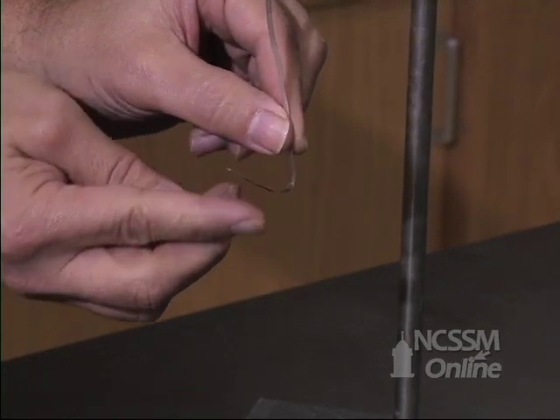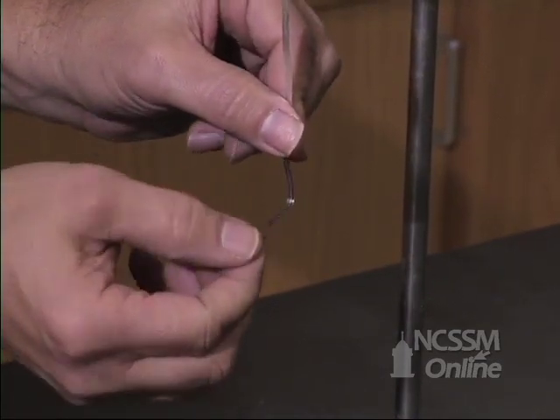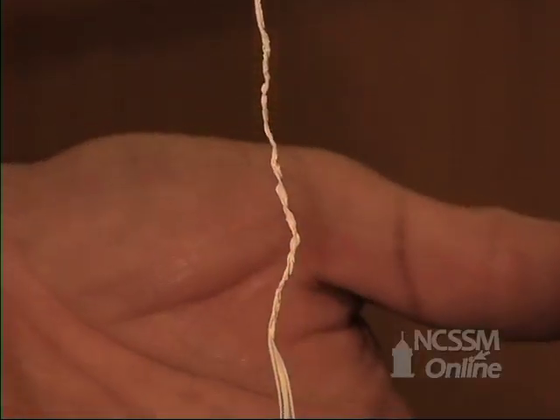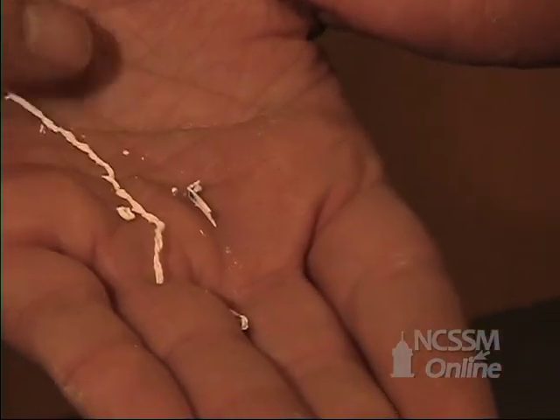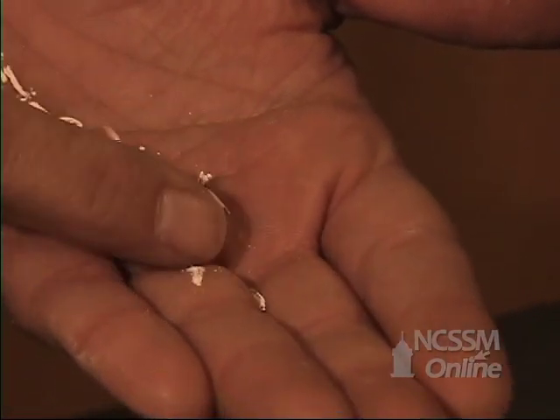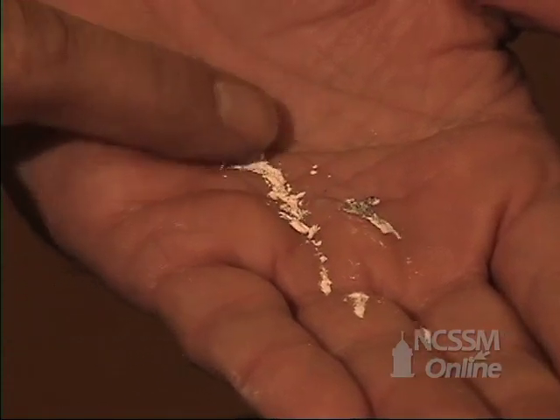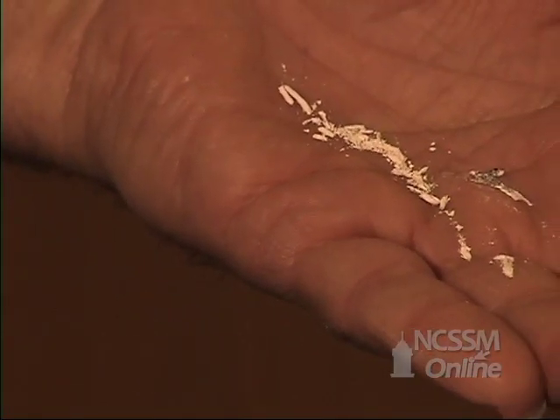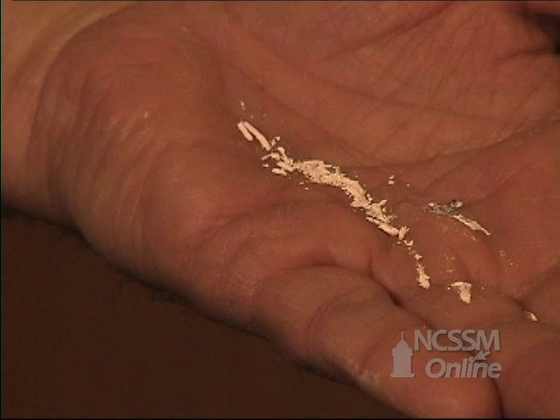Unlike the flexible metal, the ionic compound is a very brittle white solid. We have lost the properties of the original metal and we have created new properties for the ionic compound.